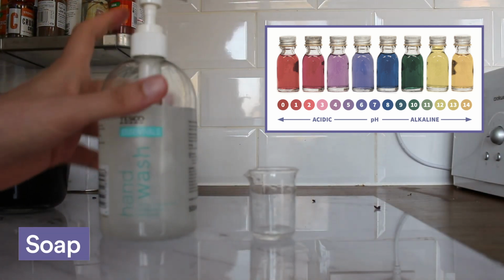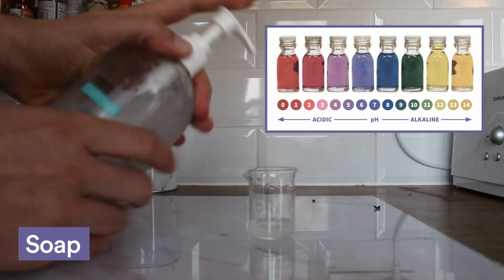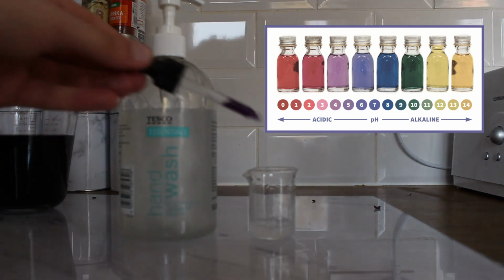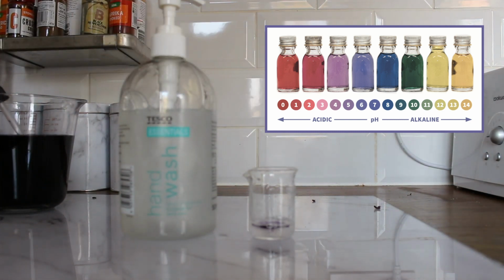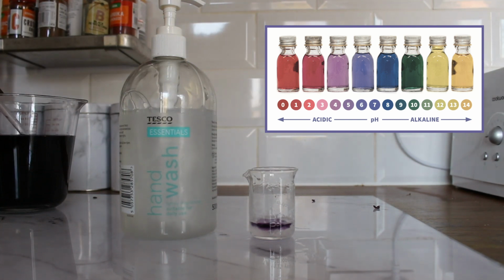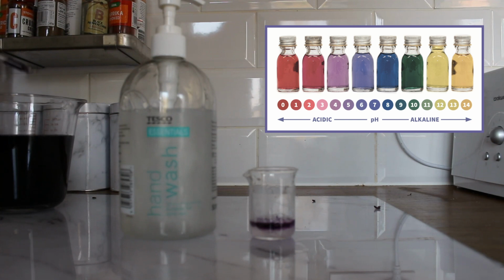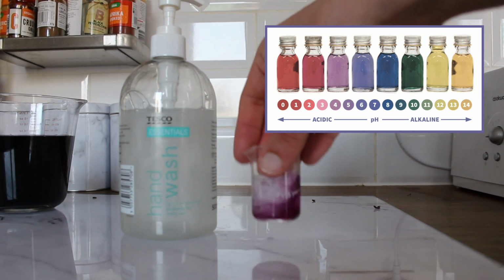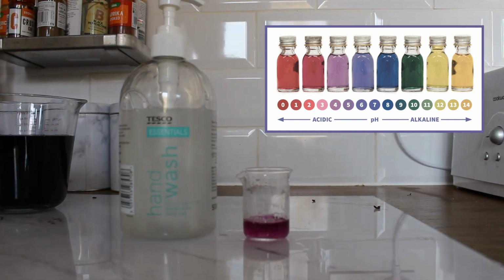In this experiment we'll be using soap. So just to show how everything around us is to do with chemistry and how everything has an acidity or a basicity, we're going to use some hand wash. So I've added some indicator here, and in a second I'll shake it a little bit so you can see the colour change, because at the moment the indicator isn't really indicating anything. So I'm about to shake the mini beaker now, and hopefully you can see that it's gone from purple to a really mild pink, which means that this hand soap is ever so slightly acidic.